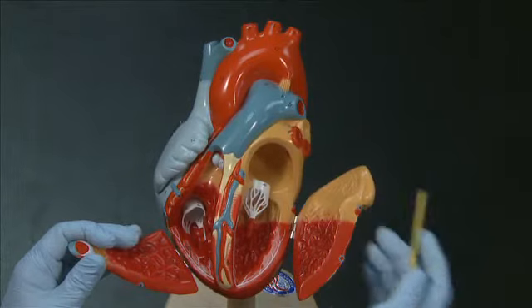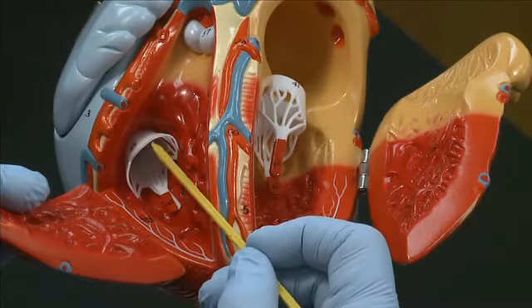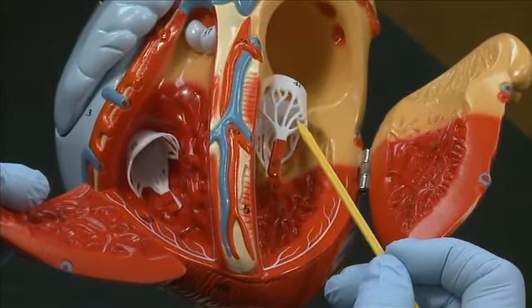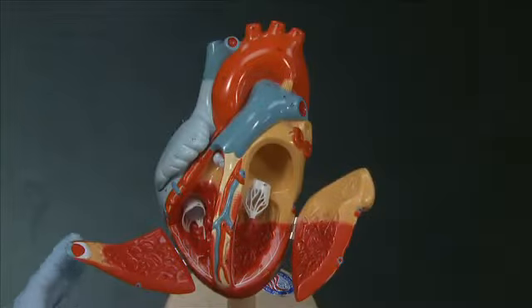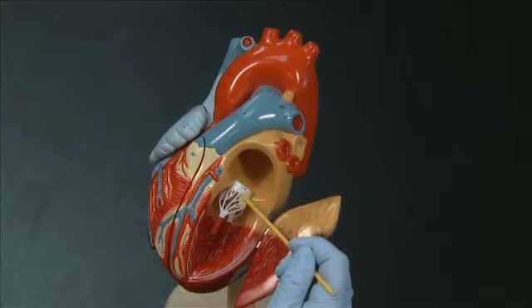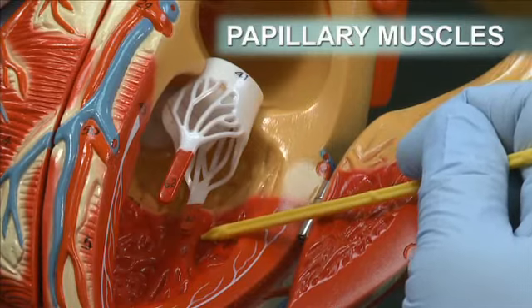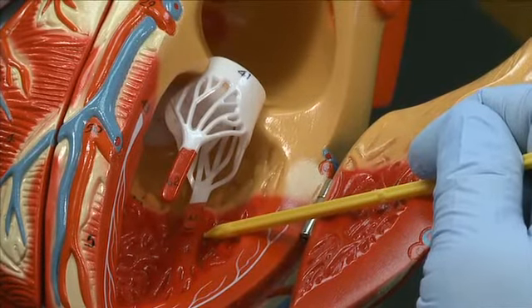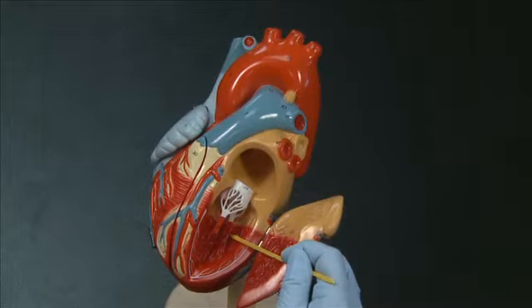The upper and lower chambers of the heart are separated by atrioventricular valves. On the right side of the heart, this valve has three cusps, so we call it the tricuspid valve. And on the left side of the heart, the valve only has two cusps, so we call that the bicuspid valve or the mitral valve. The AV valves are anchored by these thin white collagen filaments called the chordae tendineae, which are attached to the walls of the ventricles at the papillary muscles. When the ventricles contract, the papillary muscles pull the chordae tendineae so that they're taut, and this prevents the valve from everting into the atria when the ventricles are contracting, assuring one-way blood flow from the atria to the ventricles.